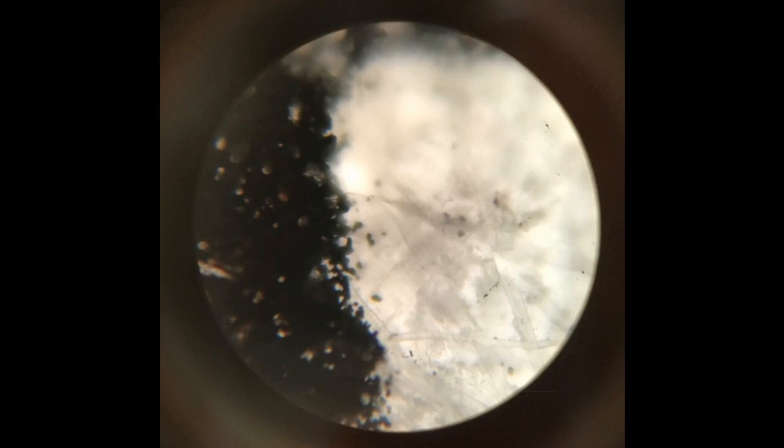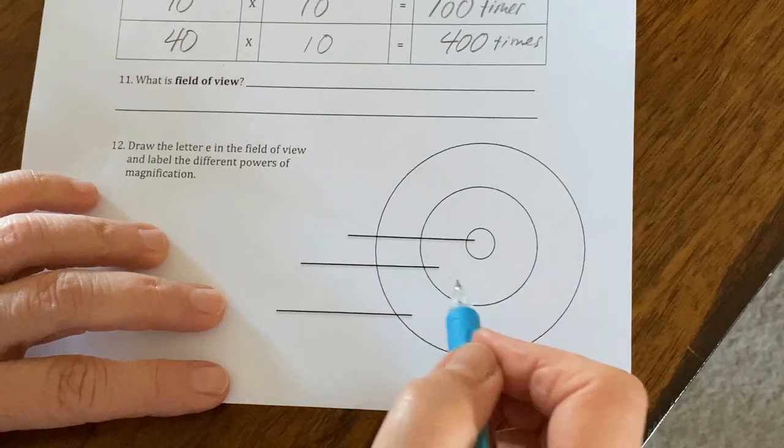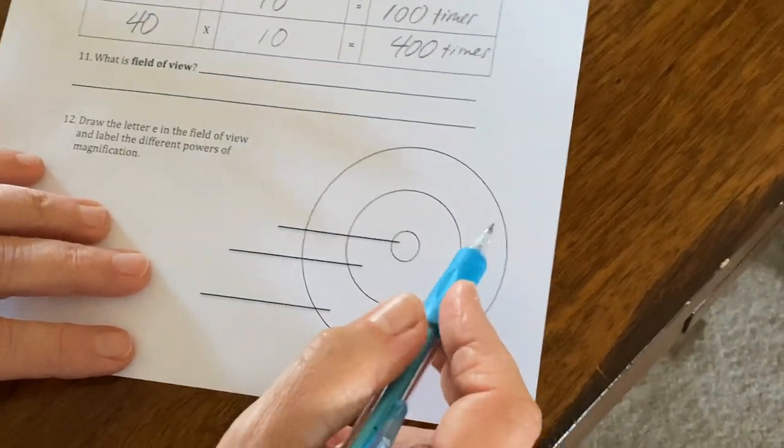And this is what's frustrating because the field of view becomes so small that if you were trying to focus it on the middle part of the E, where there's no ink, you wouldn't see anything at all. And so it can get really frustrating when you try to look at something magnified that much. Okay, so for example, now if we are looking at the microscope, and this is not to scale at all, but that gives you a better idea of how this works.